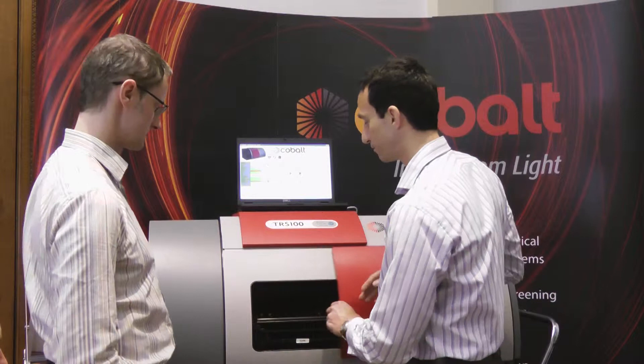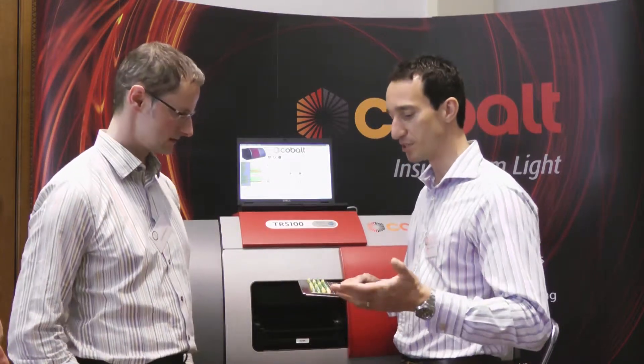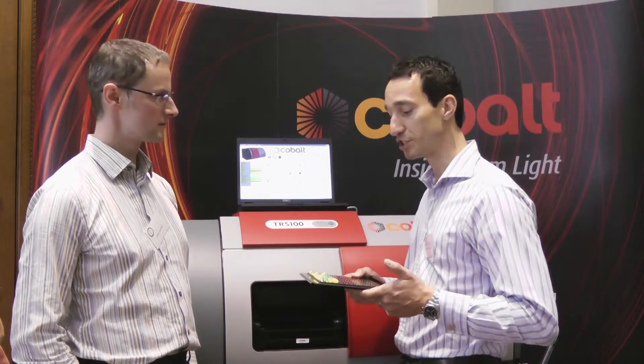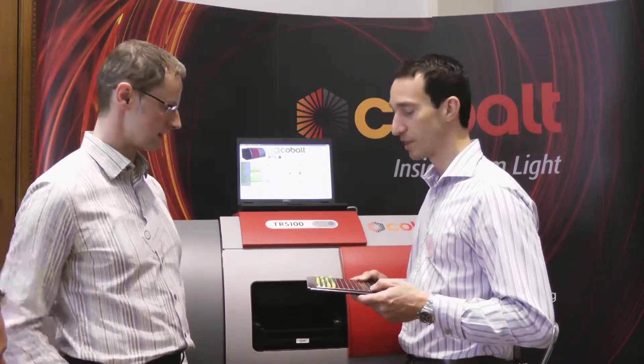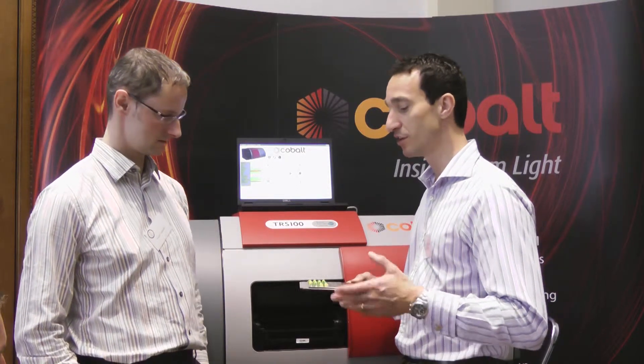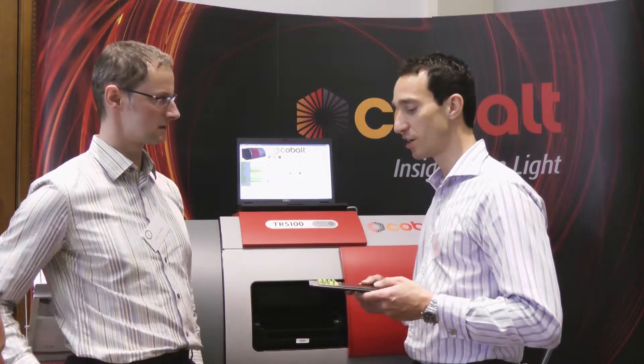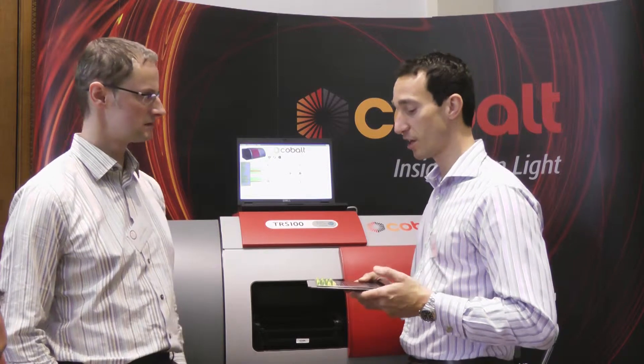So in terms of how you use the machine, can you show us it in operation? Sure. We use these trays — we load our samples, it could be tablets or capsules, there's no other sample preparation required. So you're using the capsules without taking the powder out? That's right. We aren't affected by the colour of the capsules or anything like that — we look directly through the capsule and just see the contents. And what if you had a coated tablet? Coatings aren't affected by the technique either. We could look at uncoated, but we typically look at coated tablets.